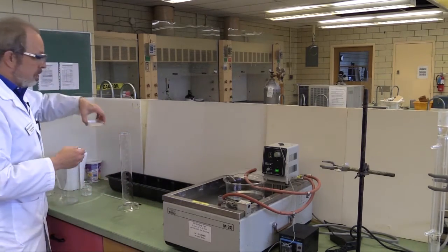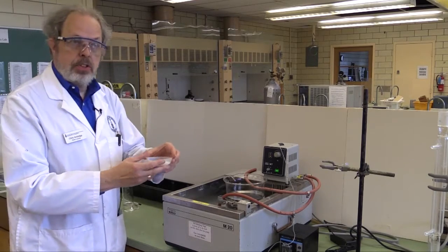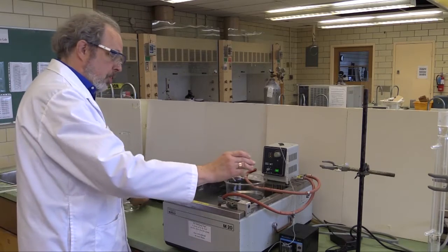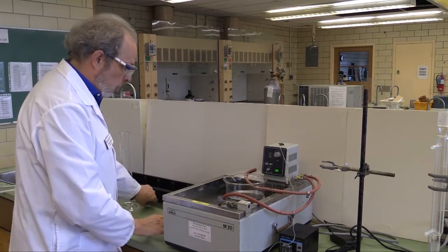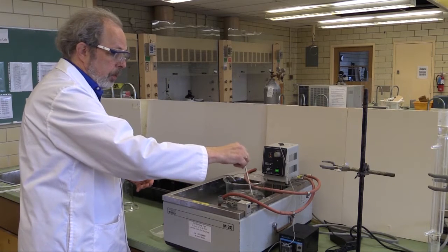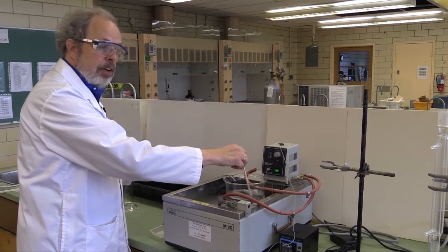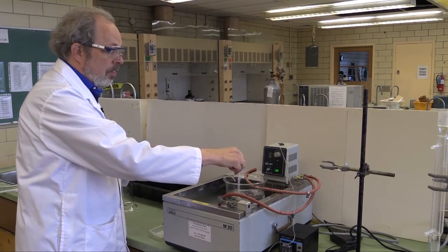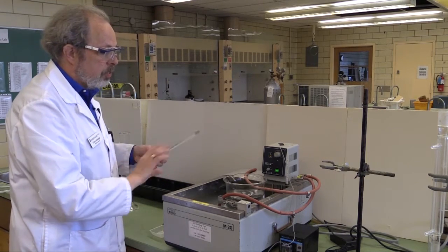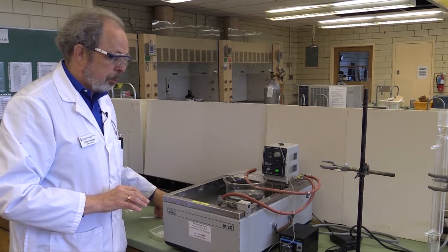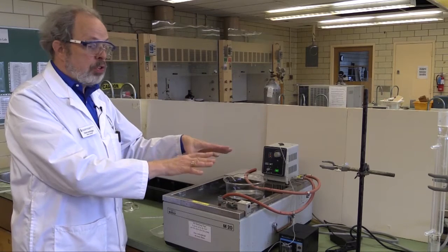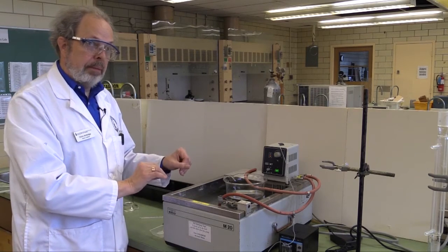You should weigh out 60 grams, which adds to 2340 to make 2400. Just pour this directly into the beaker, and you can use your thermometer to stir that around. Now, with this being 60-degree water, it's going to dissolve fairly quickly, but you do need to make sure before we do some reactions that it is, in fact, all in solution. That's the solution that is going to be reacting now. We now need to get the reactor busy.